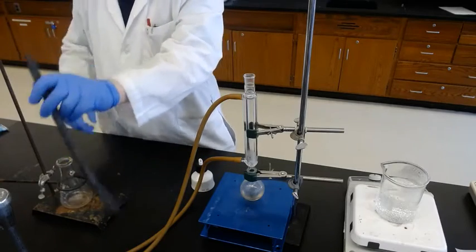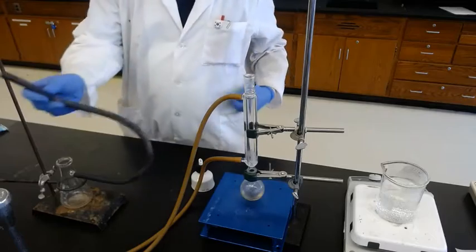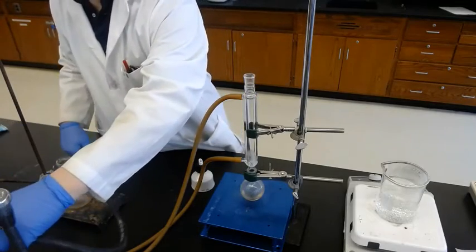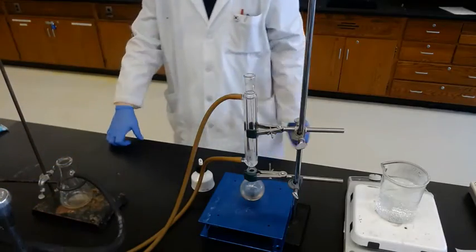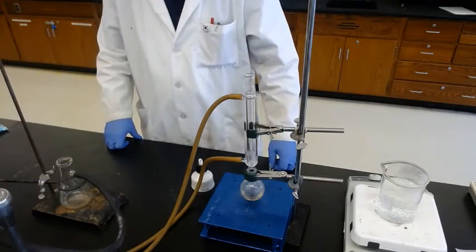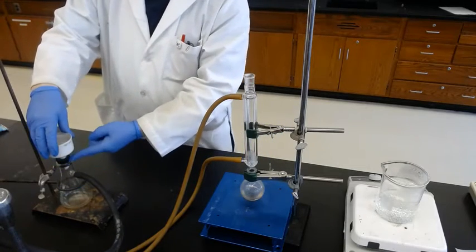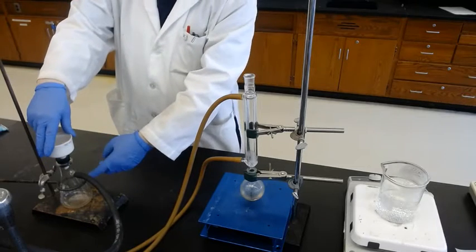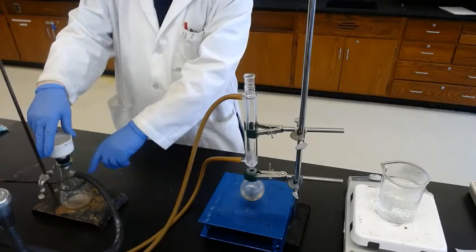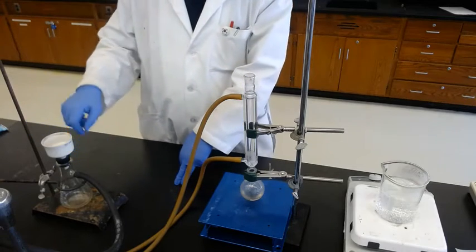And this one will go to, oh, you don't see it, the side of the water. And then put this Buchner funnel on top of it, and make sure this adapter is not all the way going in, because once the vacuum is applied, it goes inside and it's not possible to take it out. So about halfway, no more than 2/3 go inside the flask.